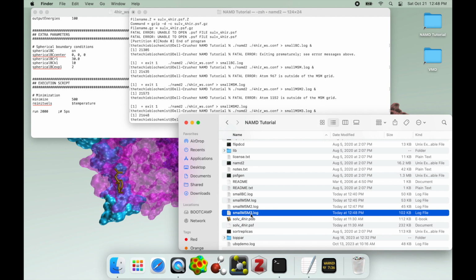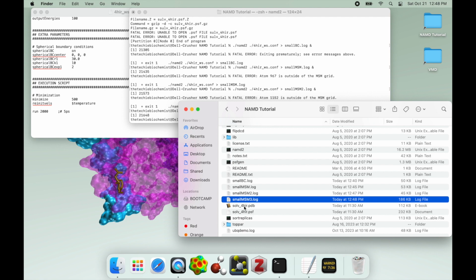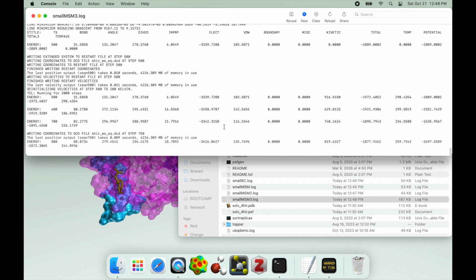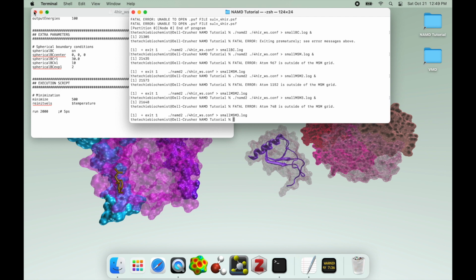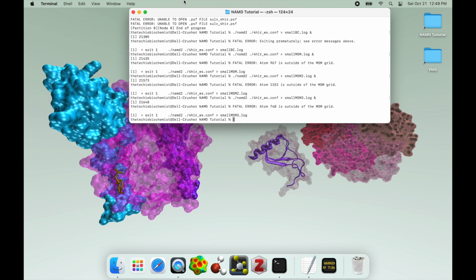This time, I'm willing to bet we'll make it to more like probably 700 steps total. Yep, there we go. I said 700, it made it to 750. Pretty good. So yeah, that's some of those errors, and hopefully that helps you troubleshoot and know how to fix them. I wish you best of luck in your endeavors.